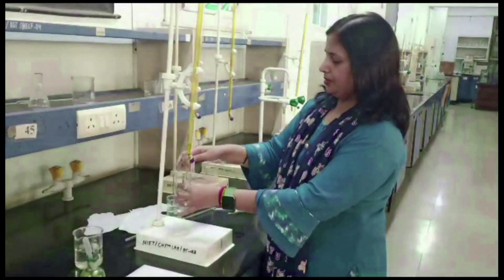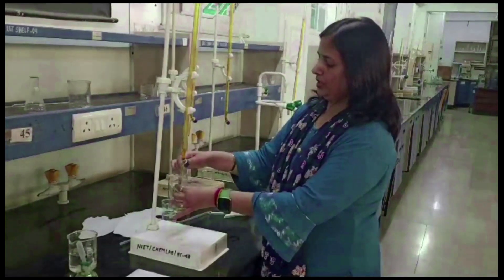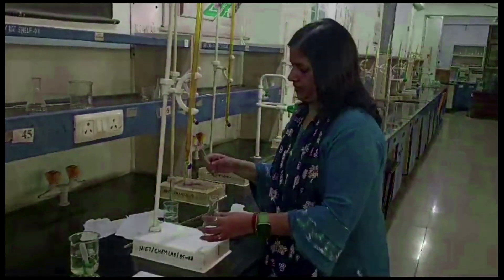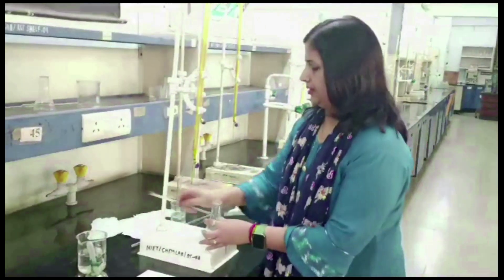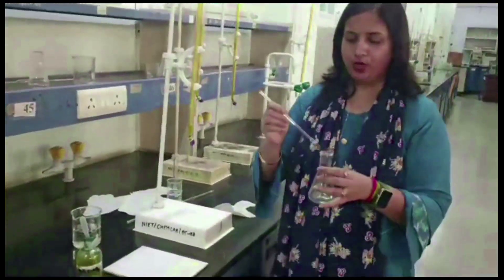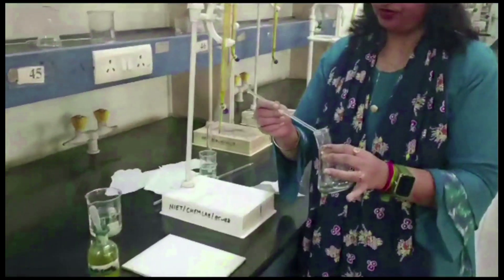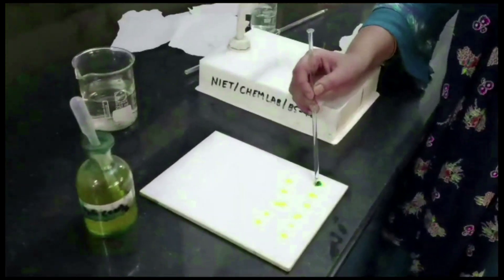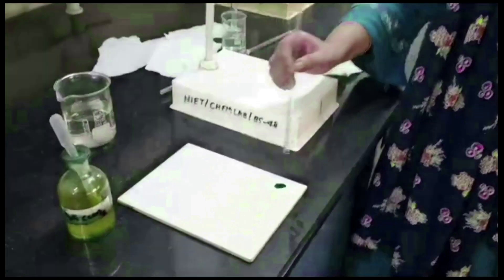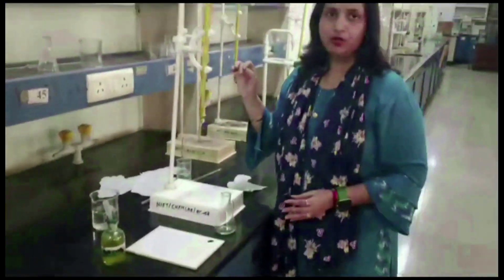In this experiment, we add directly 1 mL of potassium dichromate solution into the conical flask and shake it. Then take one drop of this solution and put it on the indicator drops on the white tile. A greenish blue color will appear, which is due to the formation of ferrous ferricyanide because of the presence of ferrous ions.